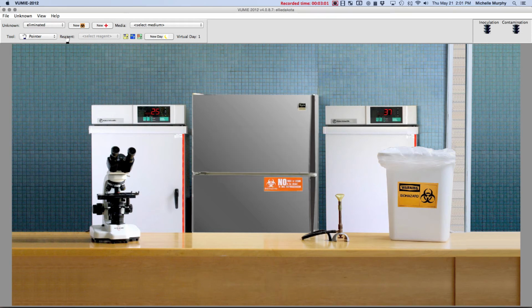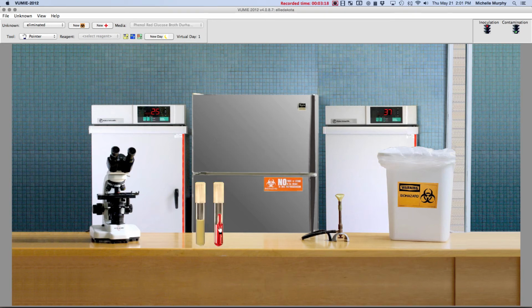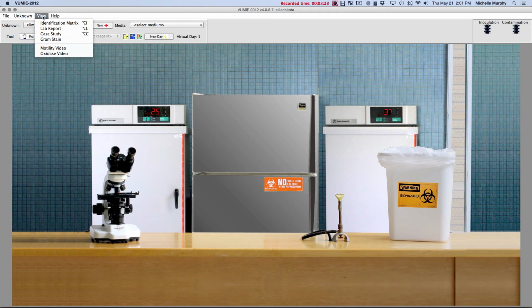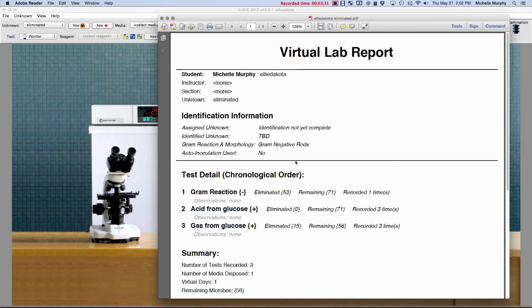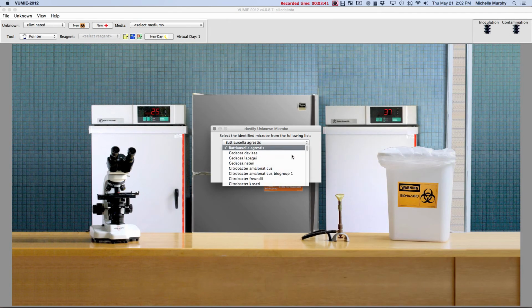In order to fix this error, I have to go back and do the test again. There it is. And put positive again. That fixed my error. Now I have some remaining. As long as I have a number here, then it will let me choose an unknown. So then I can go to unknown, identify, and pick one of these. It'll just be a guess because I haven't done enough tests to know for sure, but we'll guess this one.